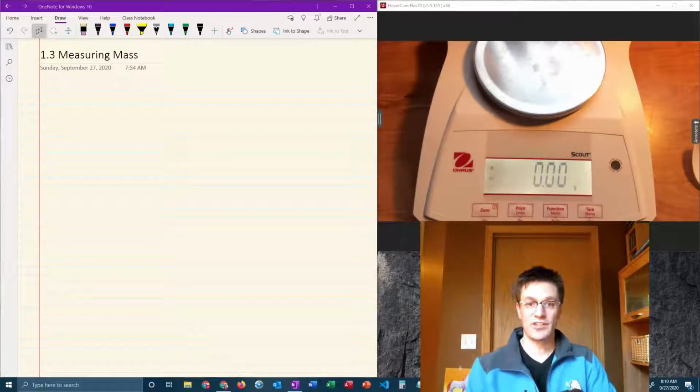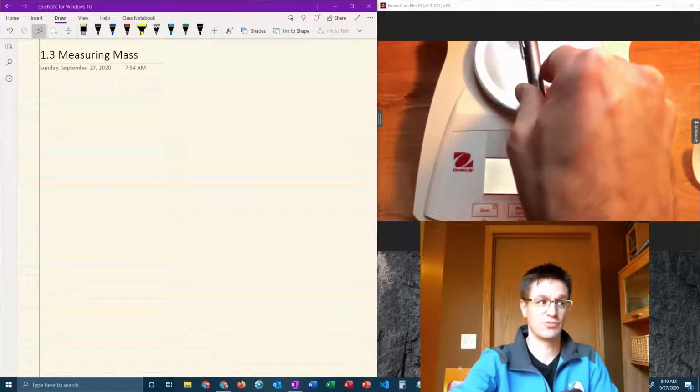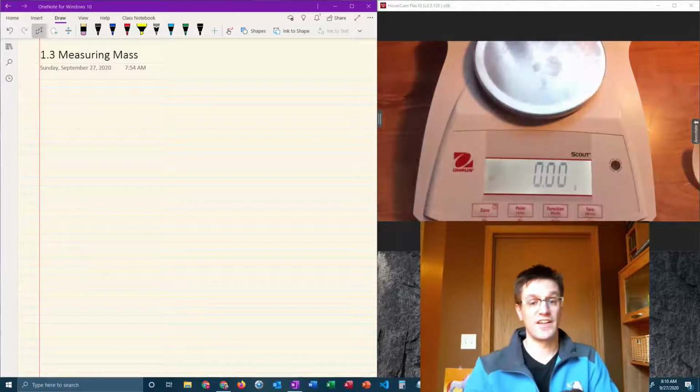In this video, we're going to take a look at how to mass things using a scale in the lab. I see the same common mistakes every year that I teach this in the classroom, and I especially want to address those things. So while this seems like a very simple instrument to use, you just put something on it and it gives you a number, there are nonetheless some mistakes that I see every year.